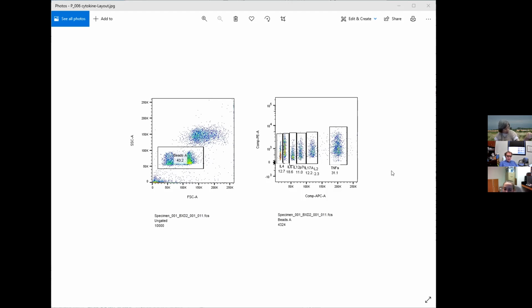I think that when I asked Anthony if this looked like what I should get, he said we don't usually use FlowJo because that's not the way you're supposed to do the analysis. Its program gave the same result. But I guess this is what it's supposed to end up like. It's not supposed to be little dots here; it's supposed to be stretched out. I think it even had a picture of it in the manual, and this looked right.